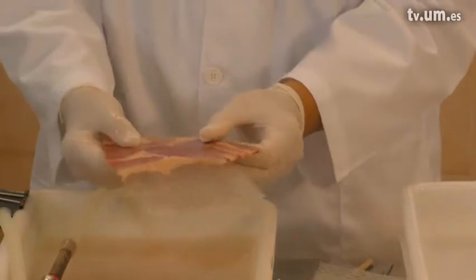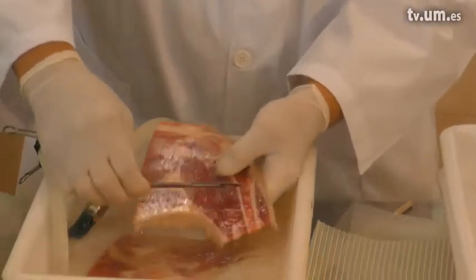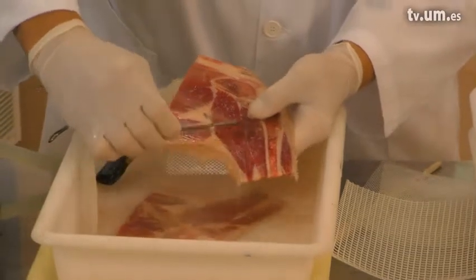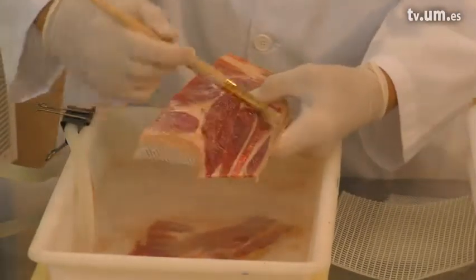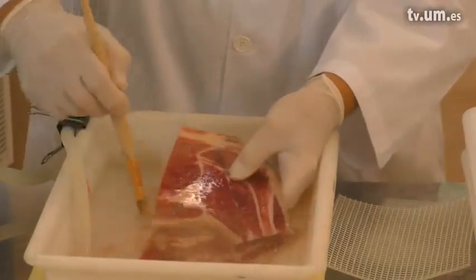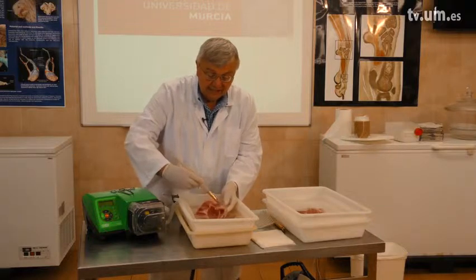Slices are put on a grid, and then we can use a scalpel blade to scrape off the sawdust — just scrape it lightly. Or we can use a brush to brush the sawdust off. Because if we don't take the sawdust off, the slices won't look nice — sawdust will plastinate like everything else.